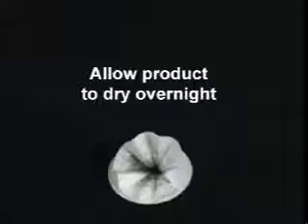If you were aiming for the solid product, take the filter paper out of the funnel and place it on another piece of filter paper or a watch glass, and allow the product to dry overnight.